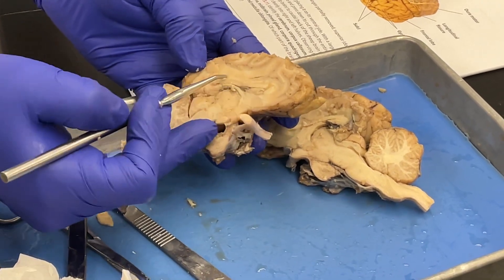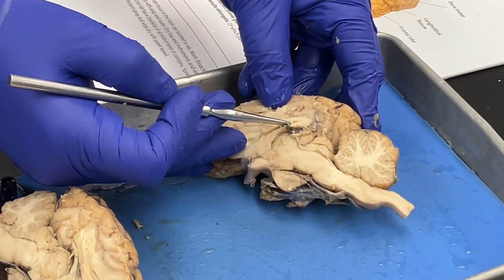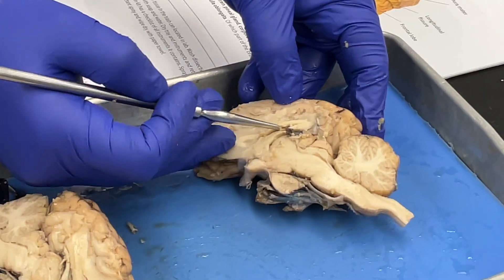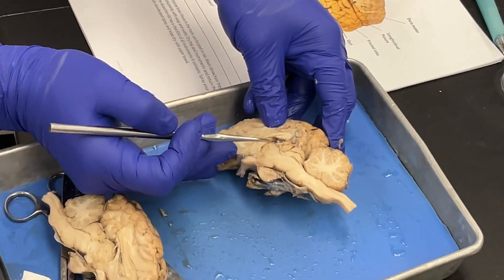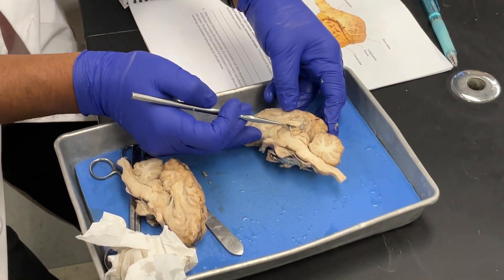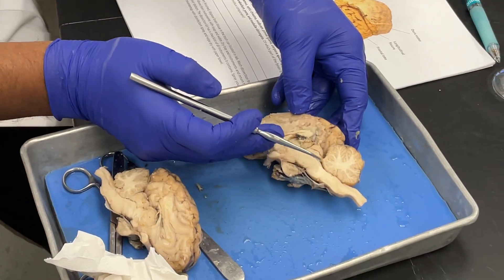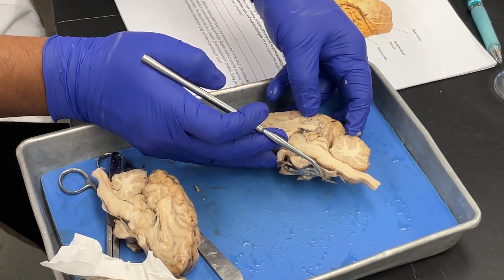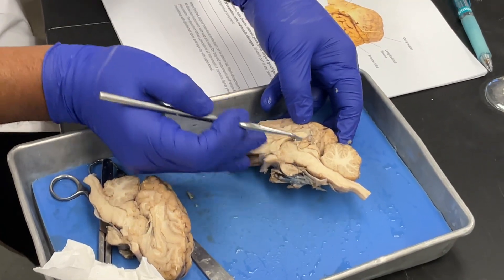Here you can see it goes into a cavity — this is the lateral ventricle. The lateral ventricle leads into the third ventricle, and the third ventricle leads into the fourth ventricle. The connection between the third ventricle and the fourth ventricle is called the cerebral aqueduct.